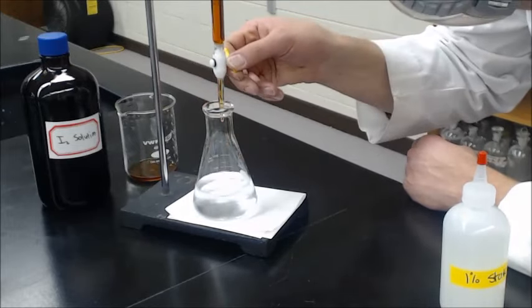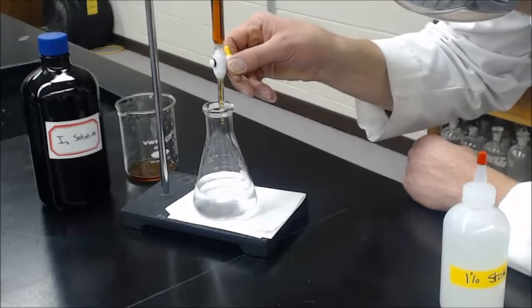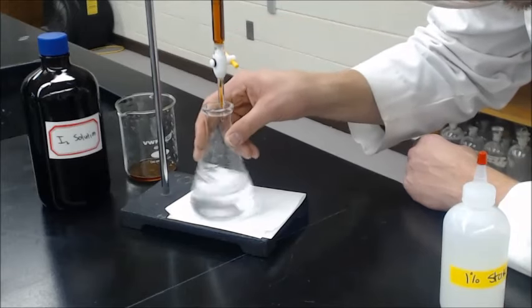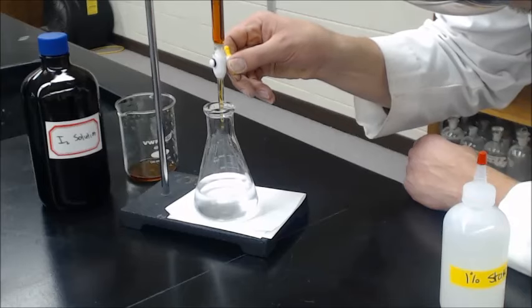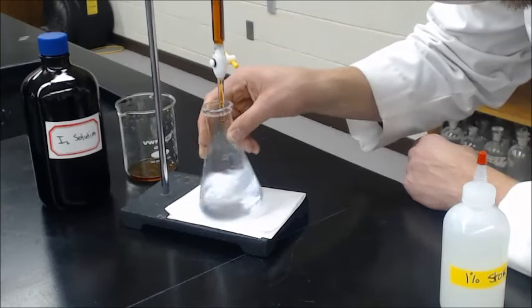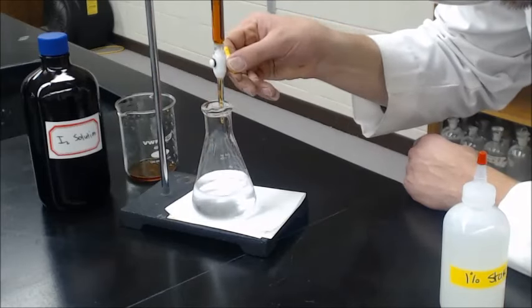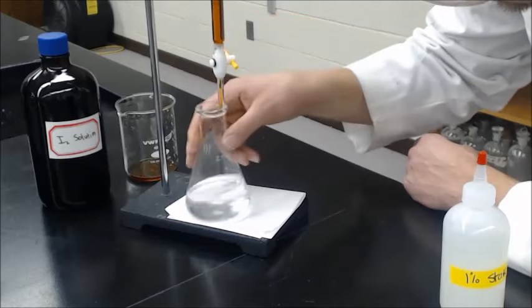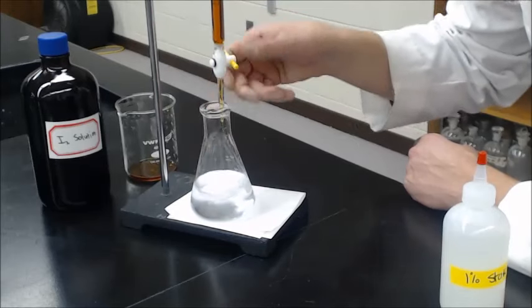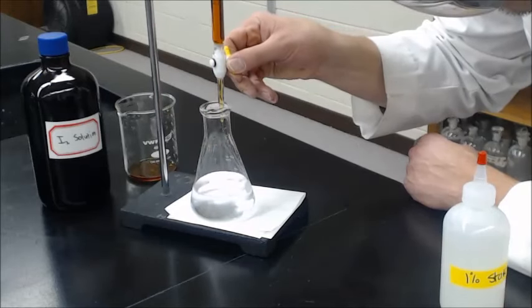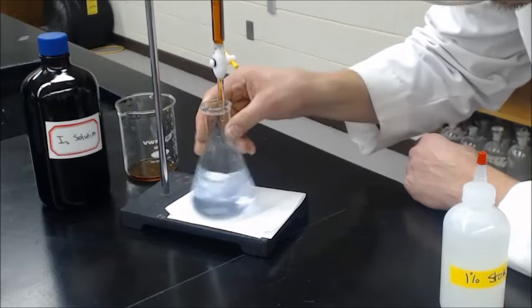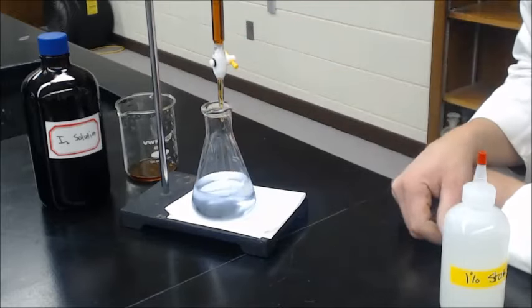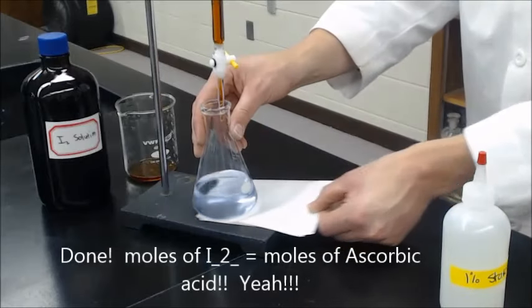I am super close now. You should be really careful when I drop. One drop. Ooh, almost there. One more drop. One more drop. Perfect. One drop and it is turned.